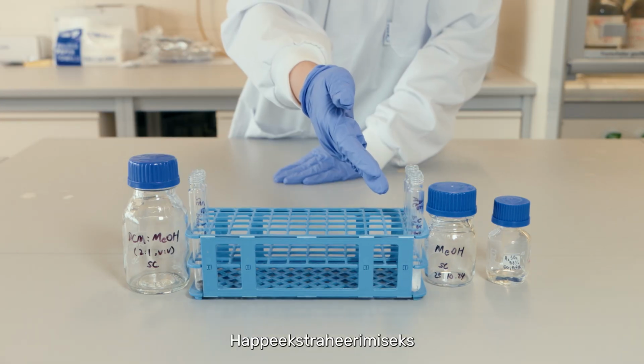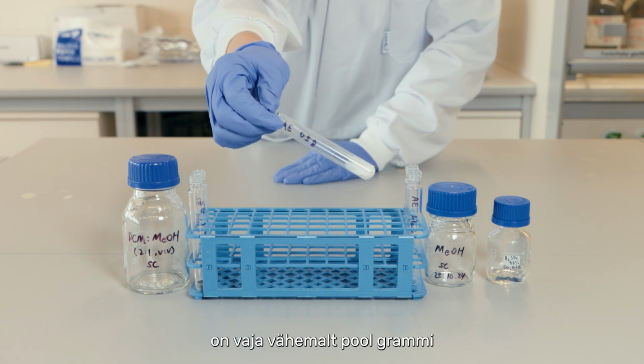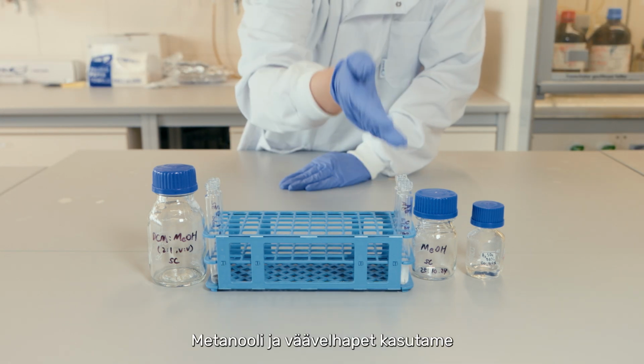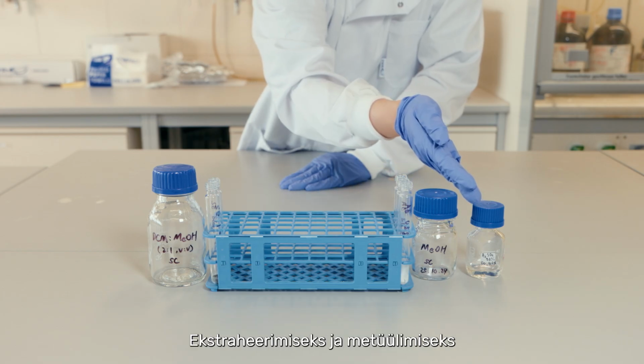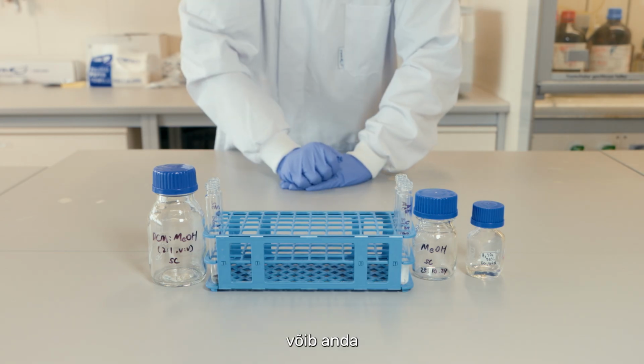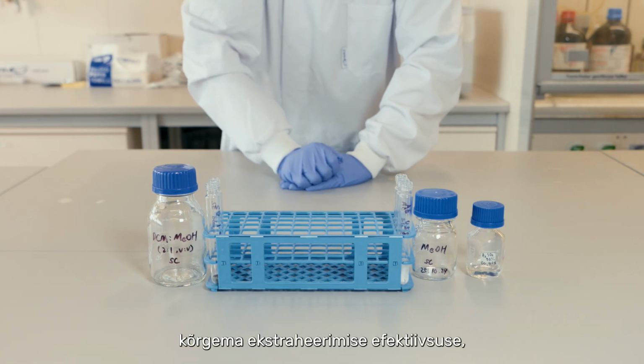For acid extraction, we need at least ½ gram of the ceramic powder per sample. We will use methanol and sulfuric acid for extraction and methylation. Acid extraction can generate a higher extraction efficiency, but the large lipid compounds, for example triacylglycerides, will be hydrolyzed.